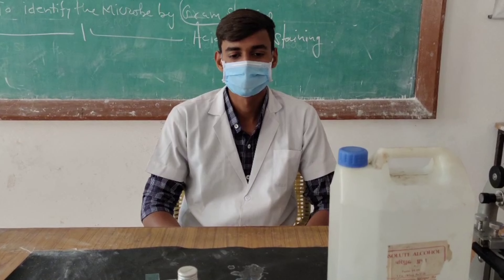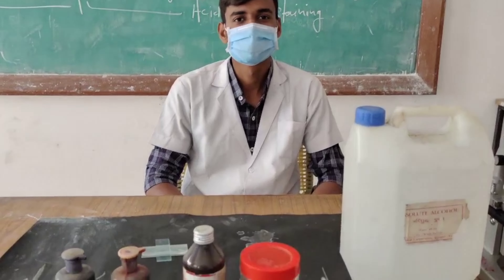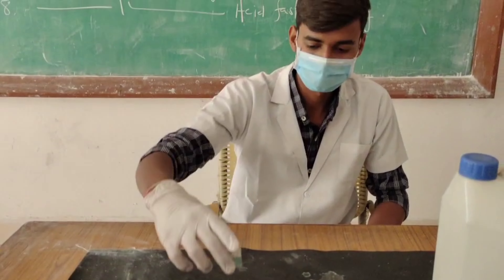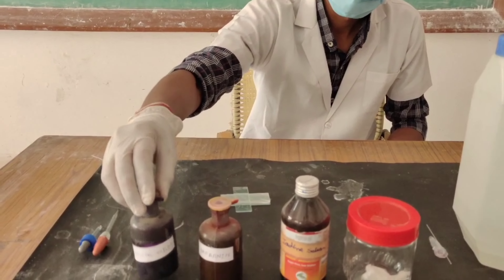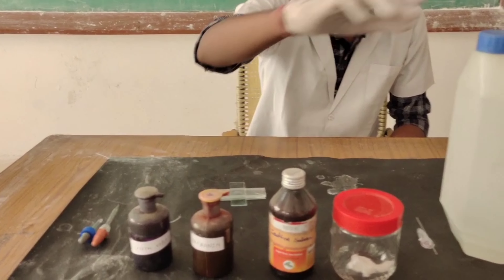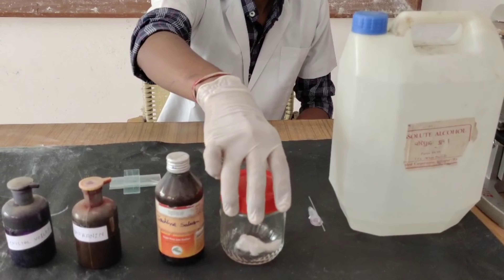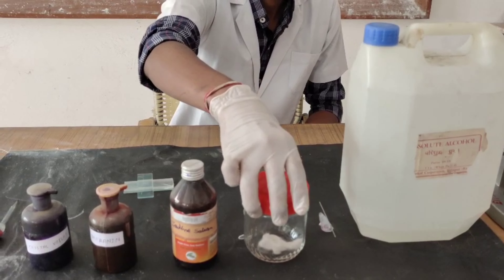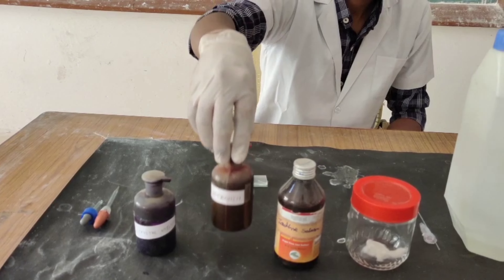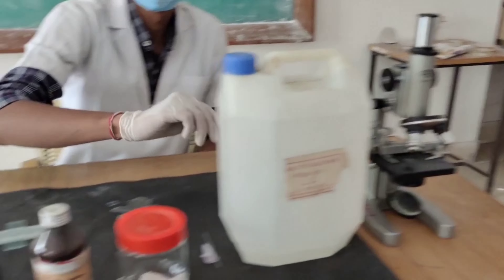The objective of today's experiment is to identify microbes by Gram-staining. The requirements for this experiment are slides, crystal violet, 95% alcohol, cotton, safranin, microscope, and iodine solution.